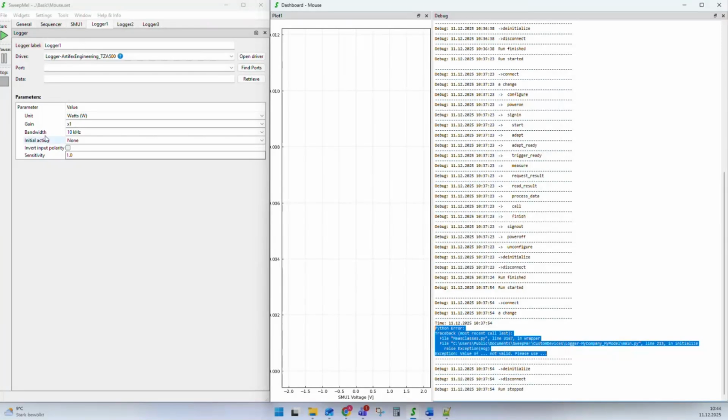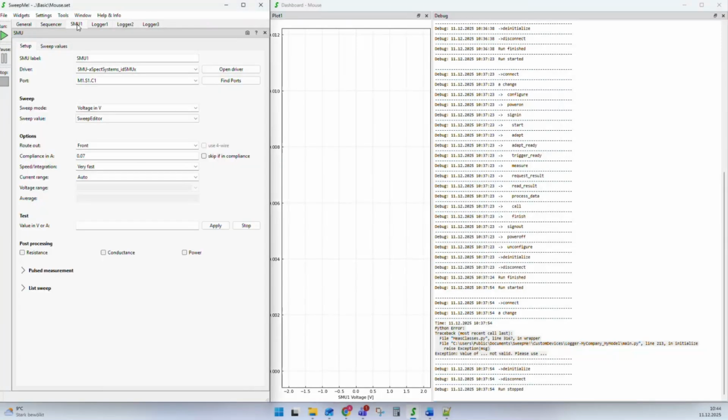There are other modules that also have this parameter box, but there are also modules like SMU. And these SMU modules have fixed properties and a fixed user interface. The idea is that if you change between two different instruments, for example, an instrument from Tektronix, from Keithley, or from Keysight, you can change the driver, but the layout stays the same and it still looks familiar. So it's easier to exchange equipment in your setup. If one instrument does not work one day or has been borrowed by a colleague, you can simply change the driver, but the user interface stays the same.